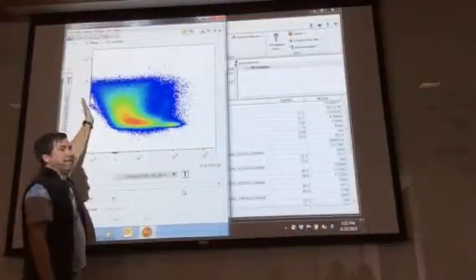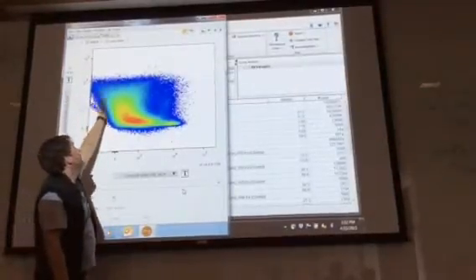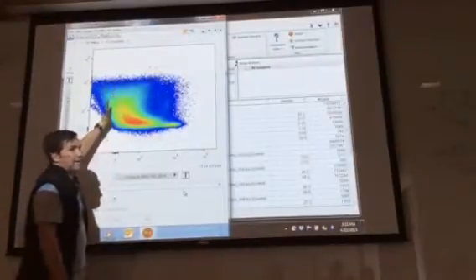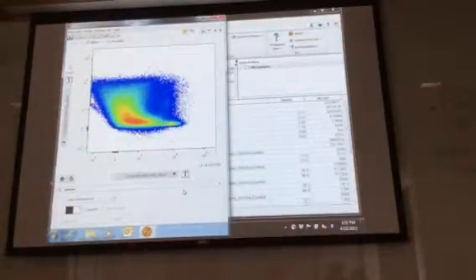But is it really negative, or is it just poorly compensated so that the data got dragged over into the negative portion of it? If you compensated it correctly, maybe it would all kind of straighten up here, and then you wouldn't have as much negative population of cells there. So that's what you're doing with the compensation.